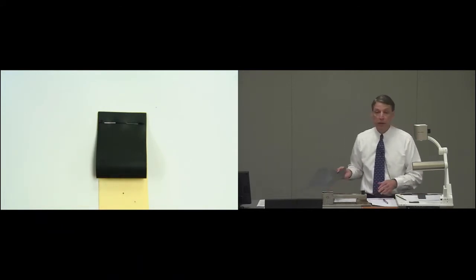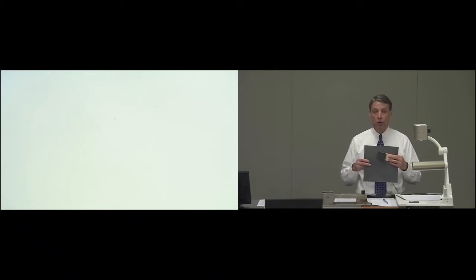The specimens are taken from a geomembrane roll in the machine direction, but the long dimension of the specimen is in the transverse direction. So 10 of these specimens are taken in the machine direction like this. And the longest dimension of the specimen is in the transverse direction. So the specimen is 146.1 millimeters in the transverse direction and 50 millimeters in the machine direction. And there are 10 of these taken down the roll.